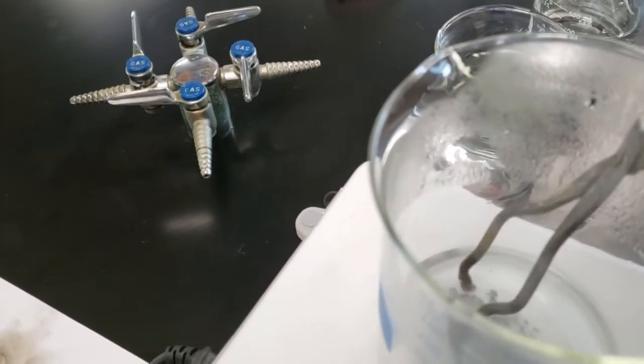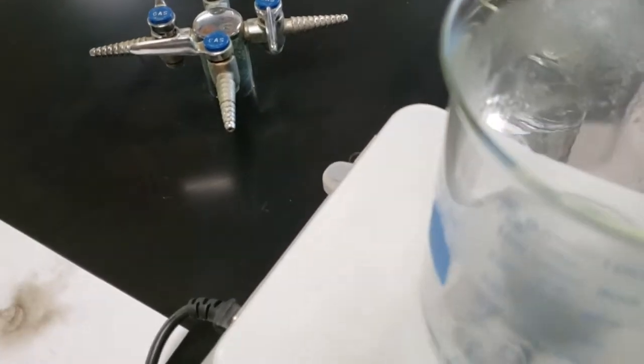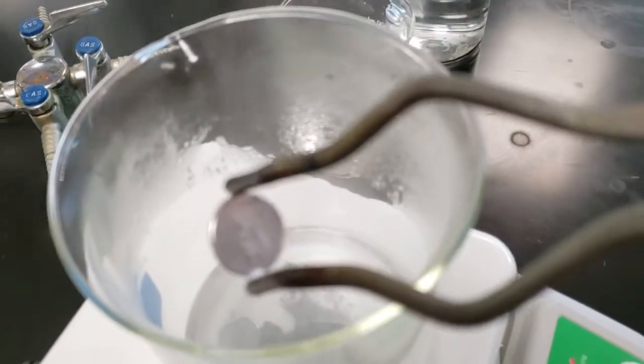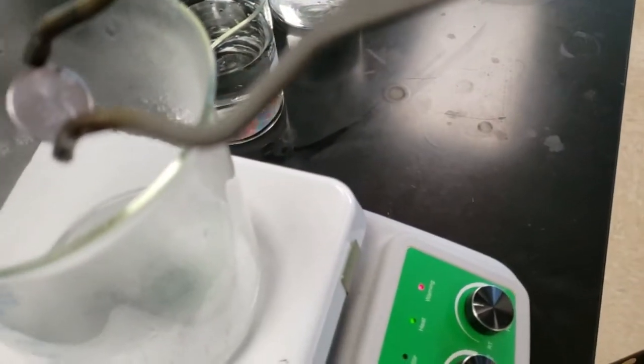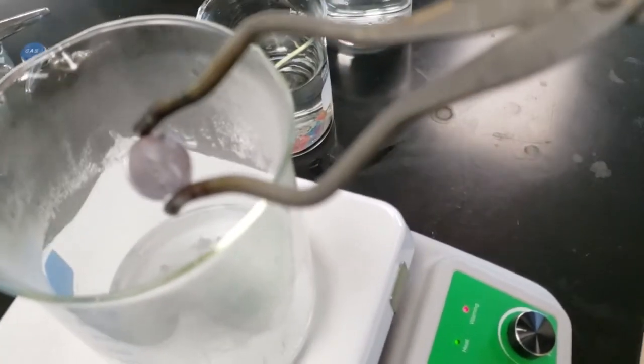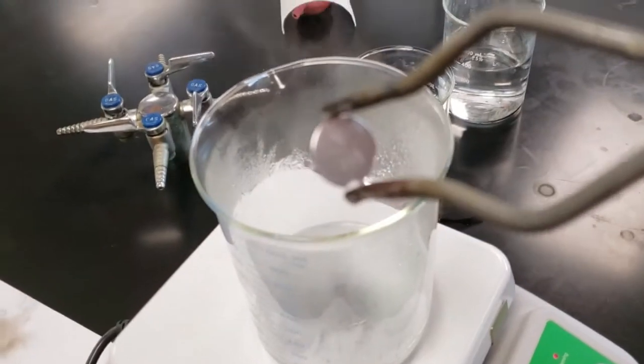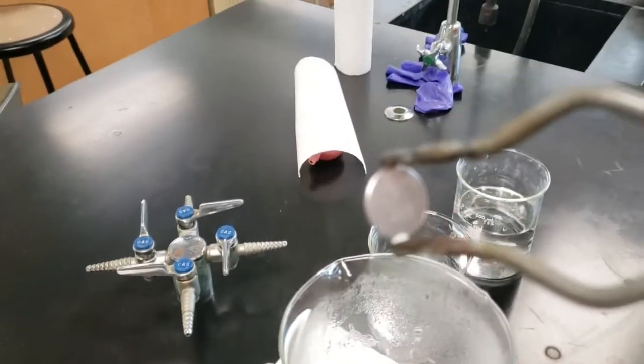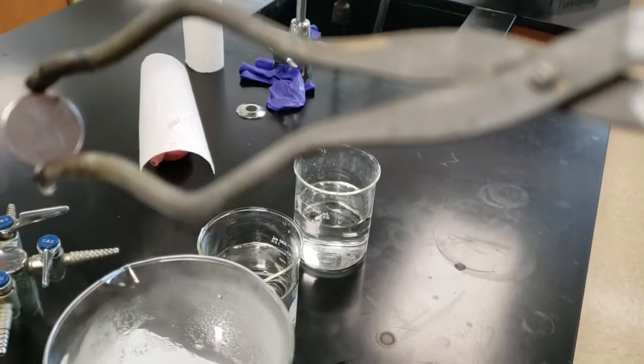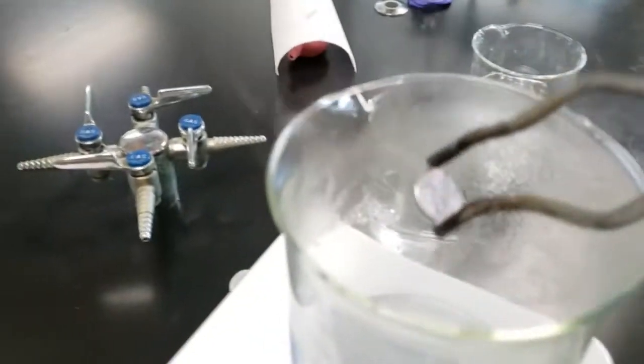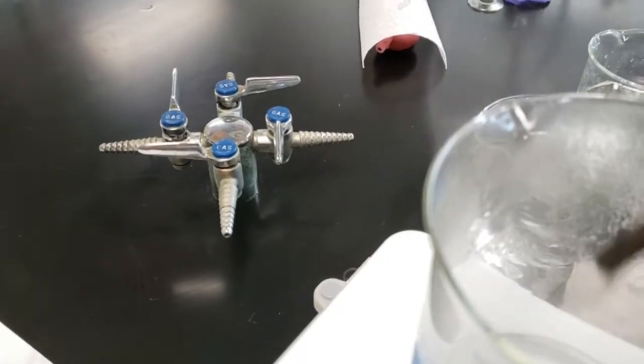People always ask me, hey Mr. Page, when is it silver? Well, when it's silver. If it's kind of coppery silver like this one is coppery silver, it's not silver. It needs to look silver, as in shiny and silver color. We're gonna put this back in and let it cook some more.